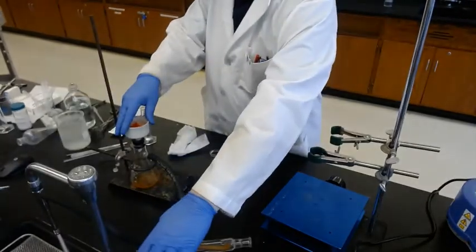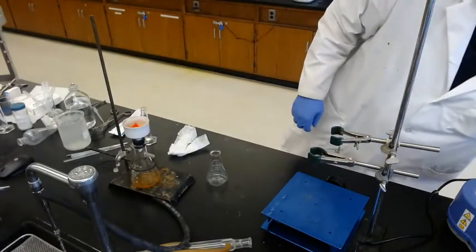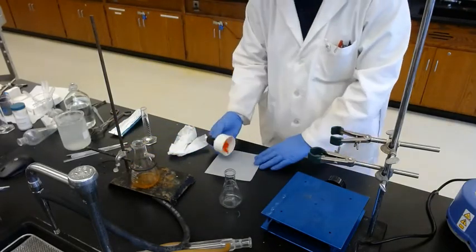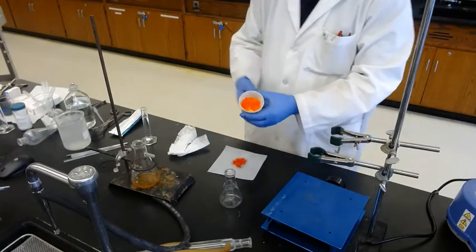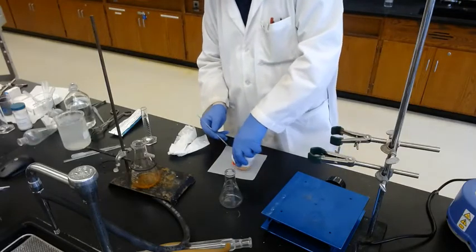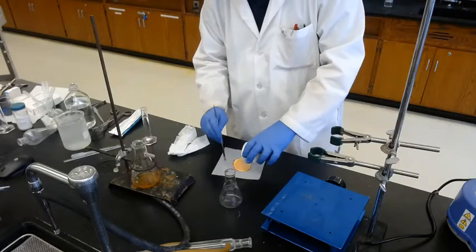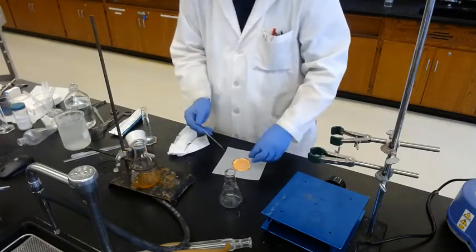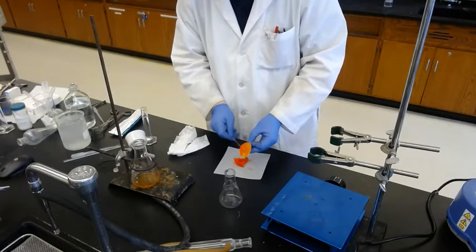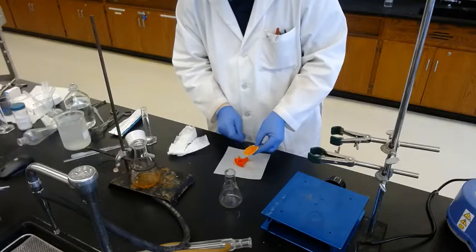First break the suction, then turn off the water. Transfer the solid and the filter paper. If the paper is not coming out, scratch around the outside — not the middle — and take the whole paper out. If anything remains, scratch it and transfer. Use the side of a spatula to transfer all the solid on the filter paper.